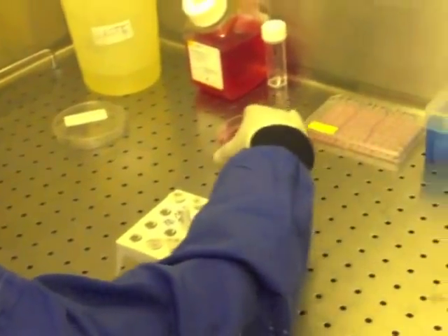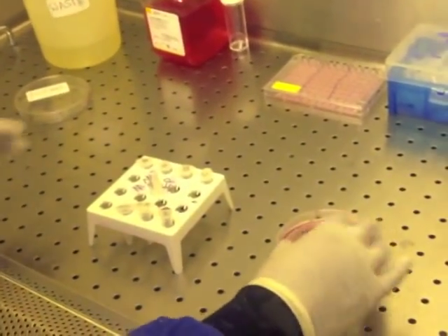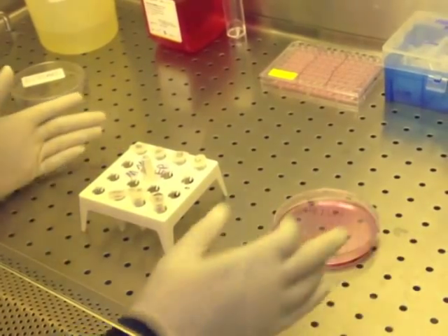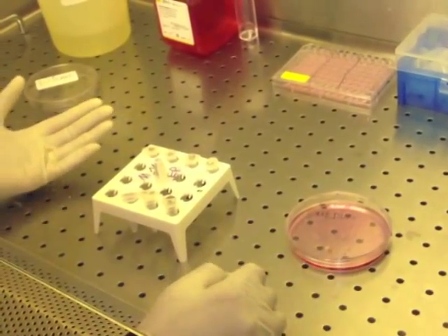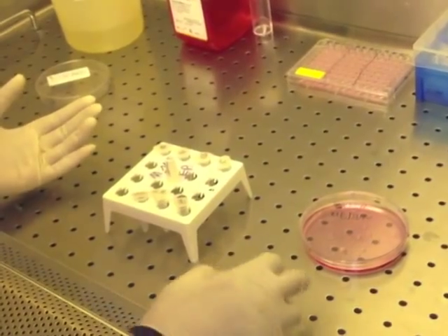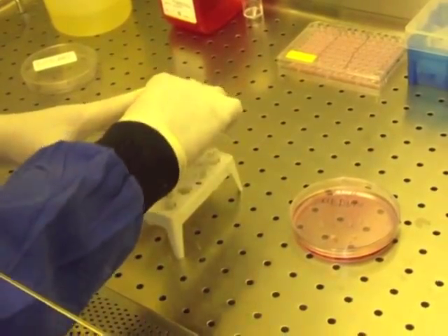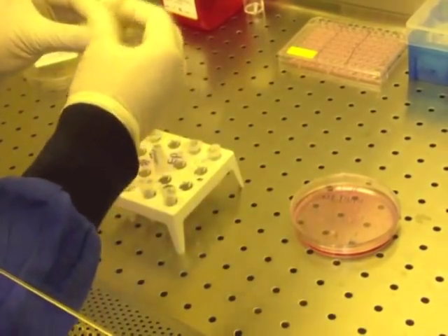Let's show you. Start off with the volume of fresh medium that you require. For example, for drug A, as we saw in class, you had to add 100 microliters of stock A to 900 microliters of fresh medium and you add that to your tube A.